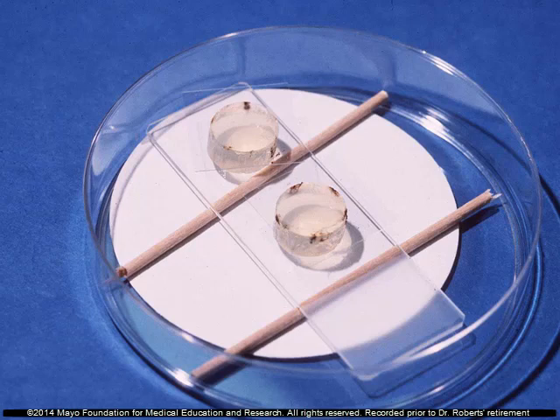Here's the inexpensive way to do it — it works well. You take a piece of filter paper, put it in a sterile petri dish, break a sterile applicator stick into it, then put the slide on there with a couple of agar plugs and inoculate it. Put a cover slip on top, let it grow, and put some water in the bottom so there's enough humidity — the filter paper will absorb the water.